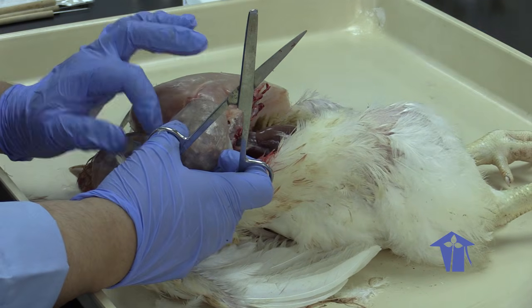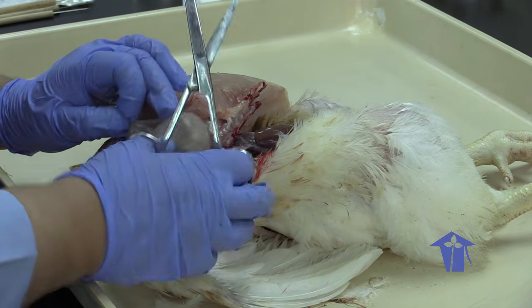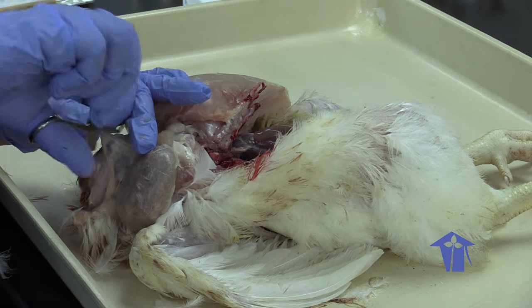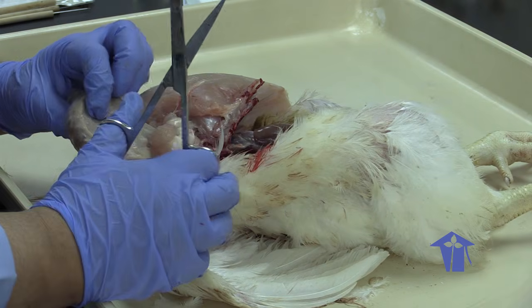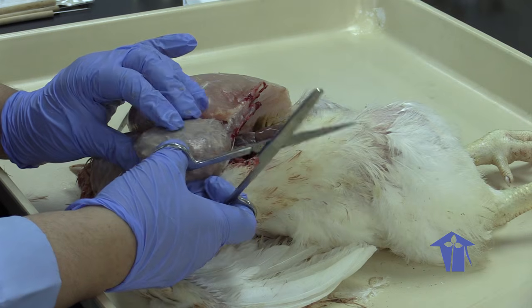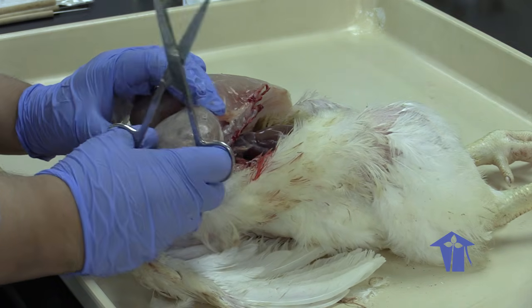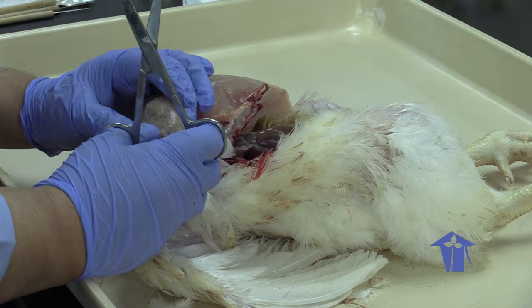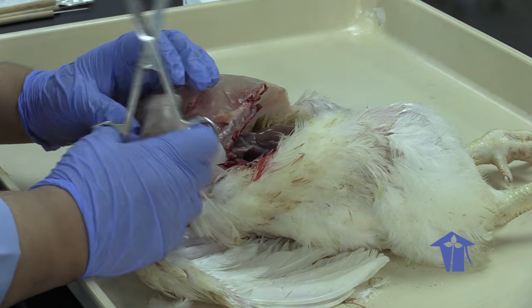Some birds, like pigeons, produce something called crop milk, where the food is enzymatically broken down and stored in the crop, and this digested food passes to the offspring. If they had starved this bird beforehand, this crop would be like a flap of skin, because it's basically just a sack.